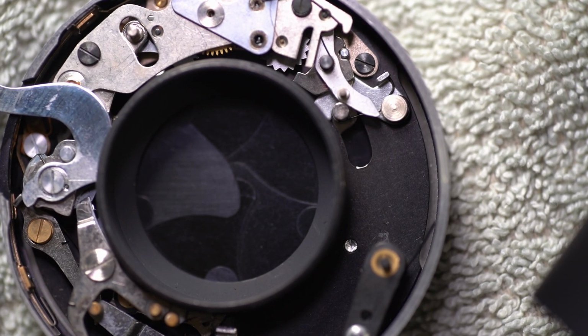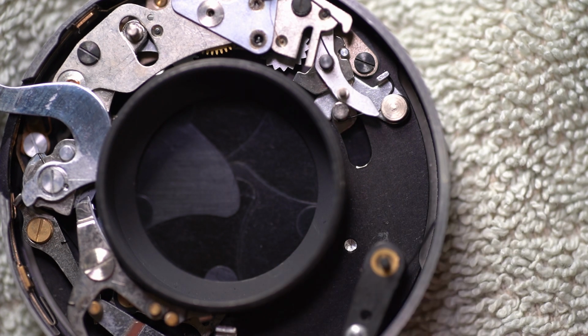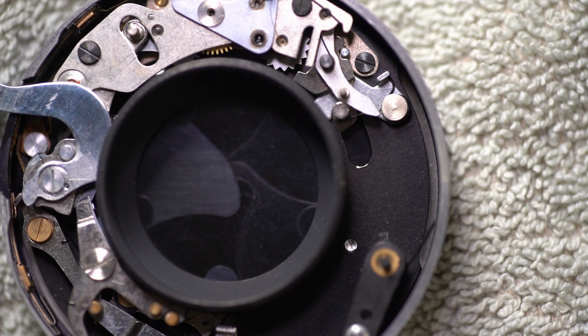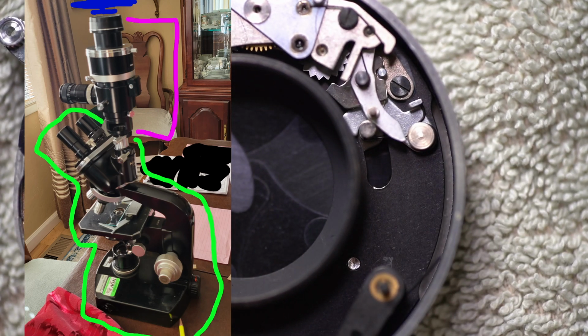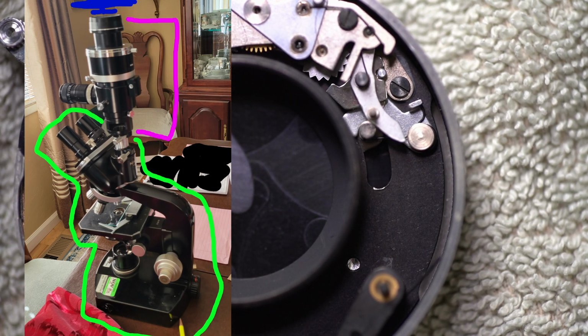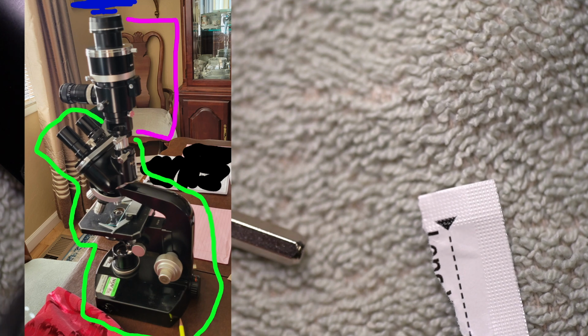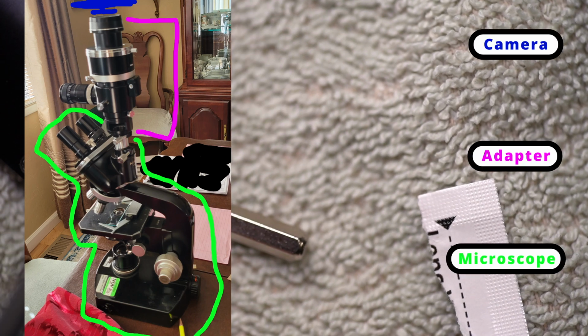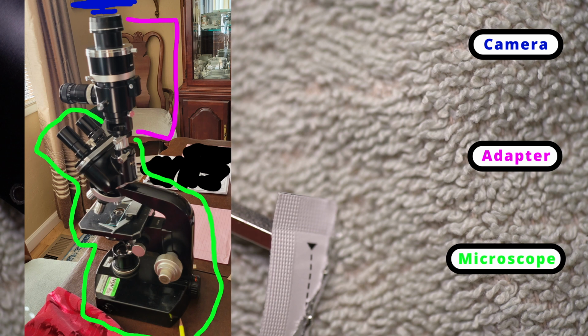This is part of my microscope, and specifically it is the shutter for the part that holds the camera, basically. This is the brains, well, not the brains, but this is the mechanism that actuates the shutter sitting up, and I can maybe put a graphic of this up or something, but you've got the microscope, you have the adapter, and your camera goes on the end of the adapter.